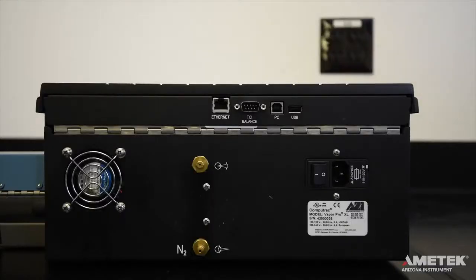To power up the instrument, first ensure that the power switch located on the back of the instrument is switched to the off position.